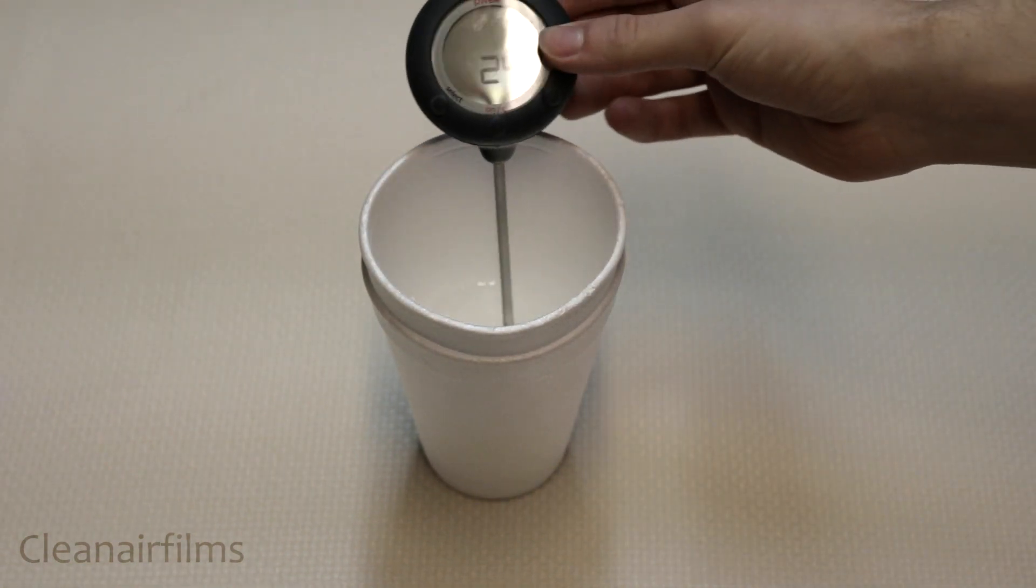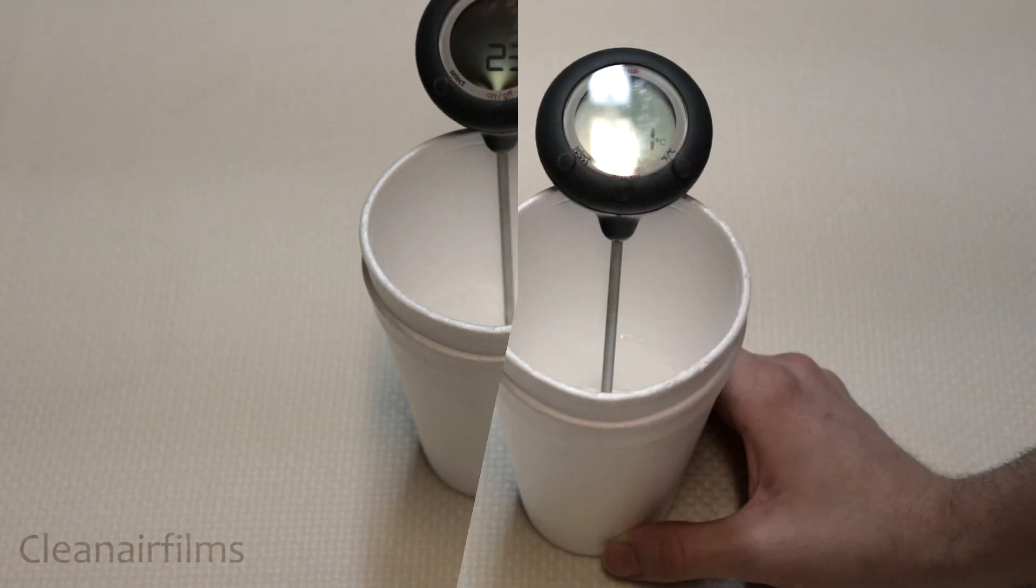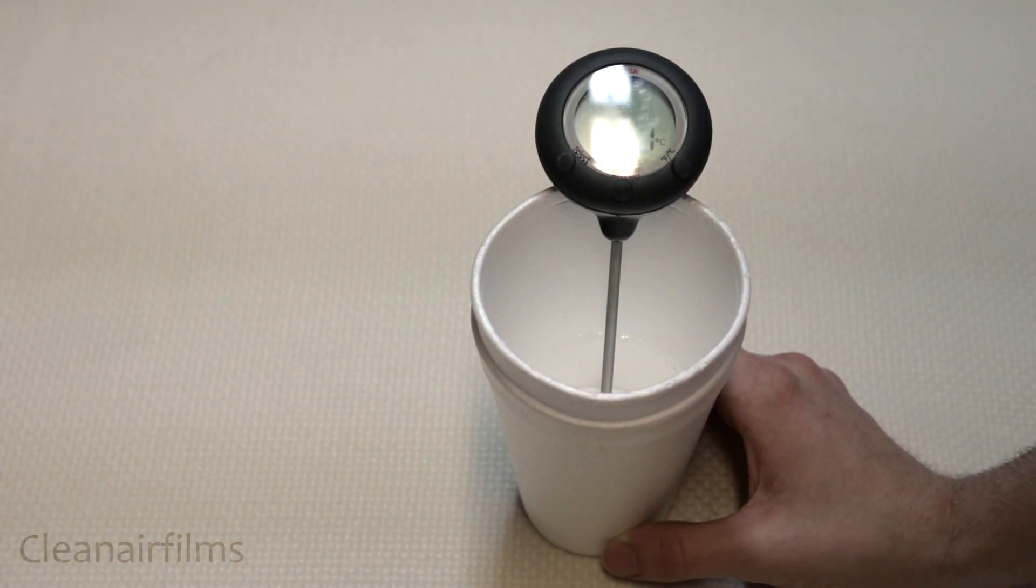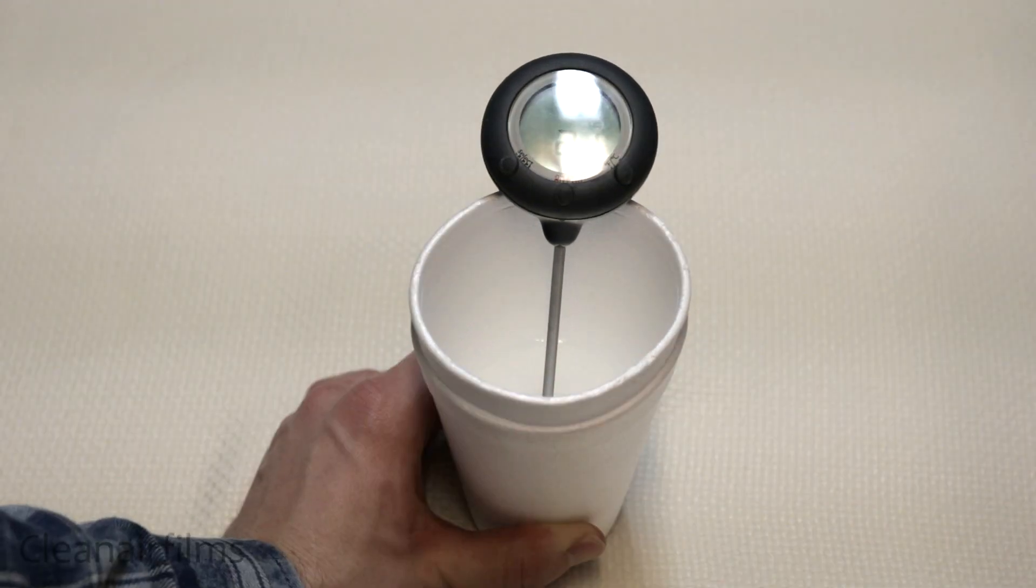Place a thermometer in the cup and let it sit for a few minutes. After a few minutes the temperature reading should stabilize. Write down the starting temperature.